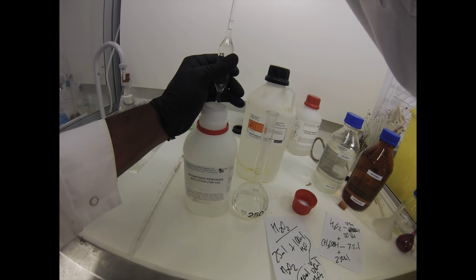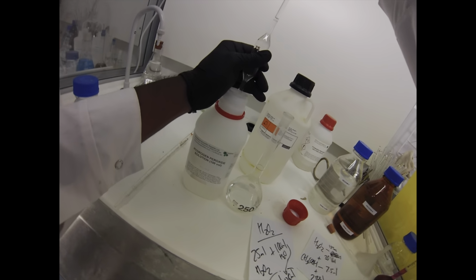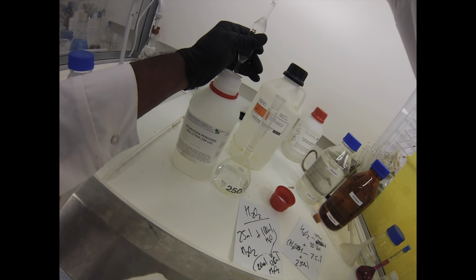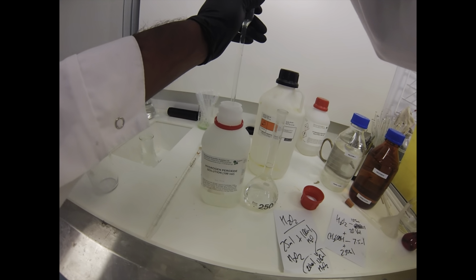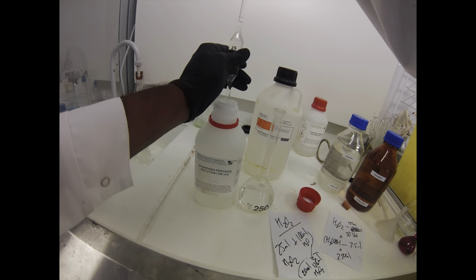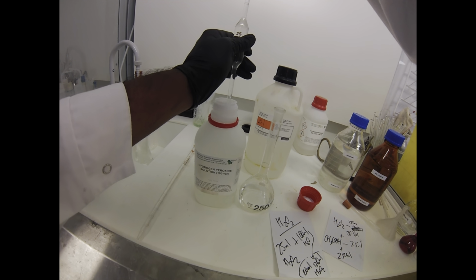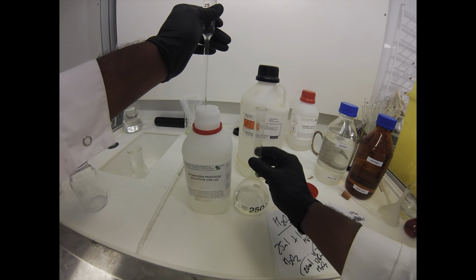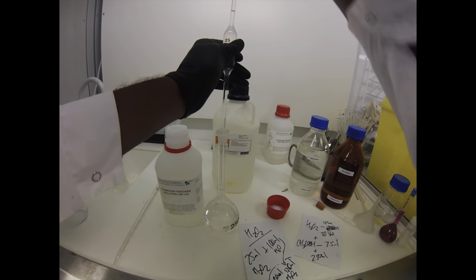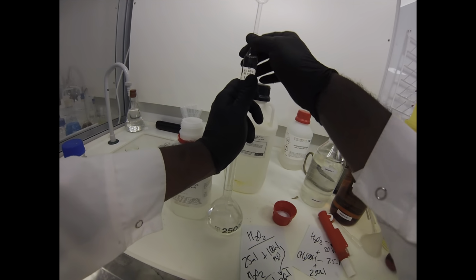So the bottom of the meniscus sits on the line. I can't count how many times I've said that in my life. Particularly with these fillers, you just got to slowly lift them up, try and get your volumetric or whatever you're pipetting into really, really close to the lid of whatever you're dispensing out of. So nice and slowly, just like that. That goes into the volumetric, and then we'll just dispense that out. The old hip click of the pipette there.